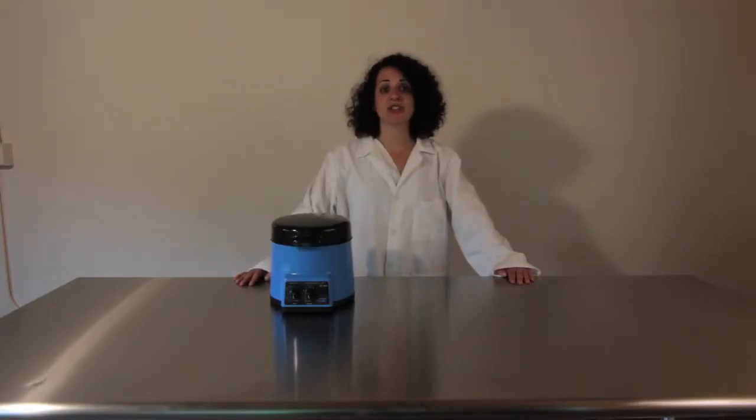The Bullet Blender can be used to homogenize a variety of tissues, including plant material. As you already know, plants can be fibrous and difficult to break down.